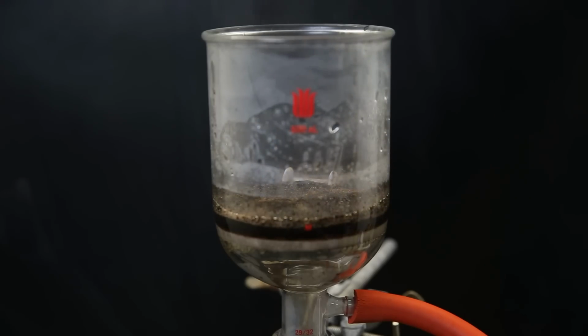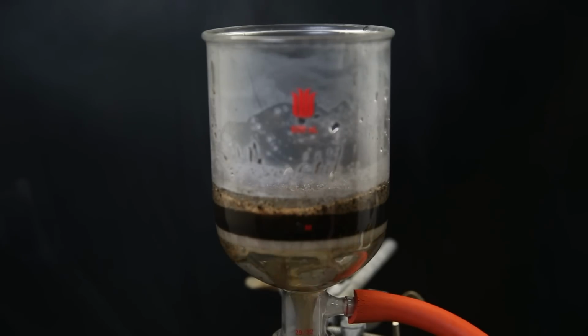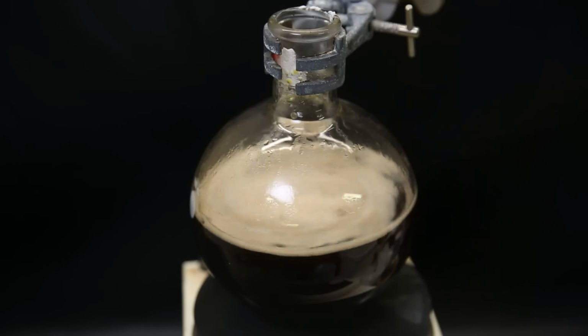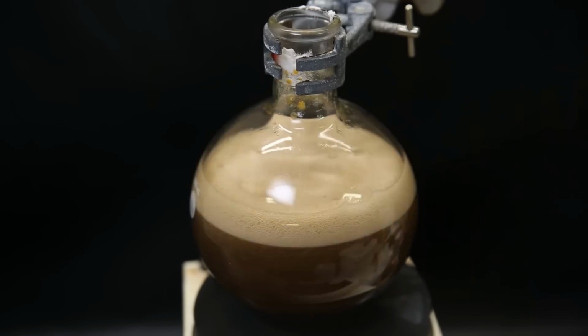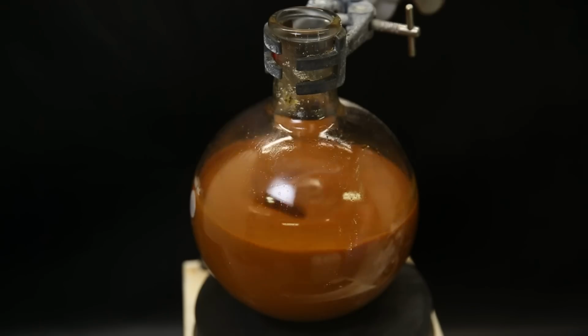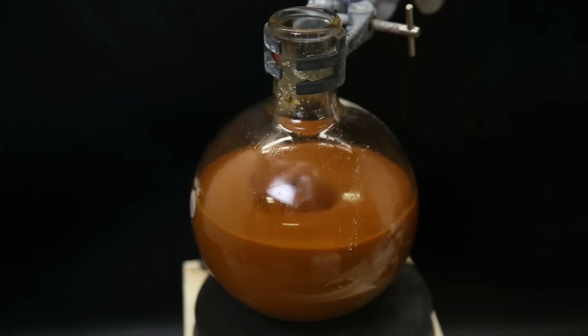Adding acid will simply convert it back into copper 1 chloride and acetylene. In literature, it is said that you can recycle the catalyst indefinitely if you wash it normally, but I don't want to keep it around. I then neutralize this filtrate with sodium bicarbonate until it stops foaming. When that is done, and the mixture is slightly basic, a precipitate forms, likely from copper chloride, which is very insoluble in neutral and alkaline solutions.